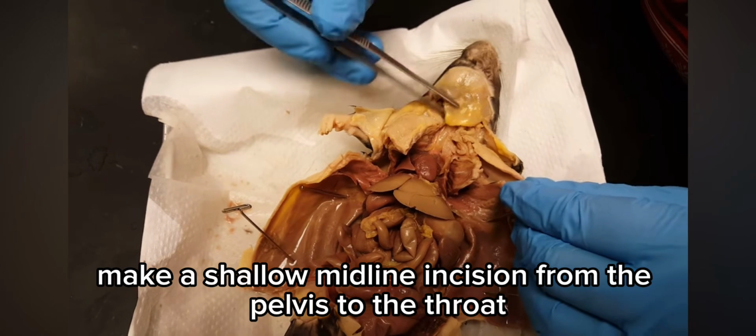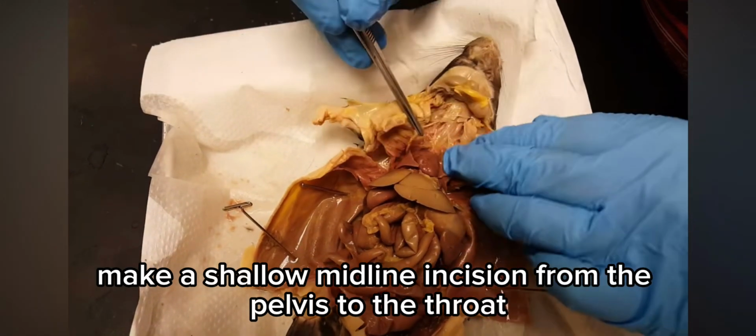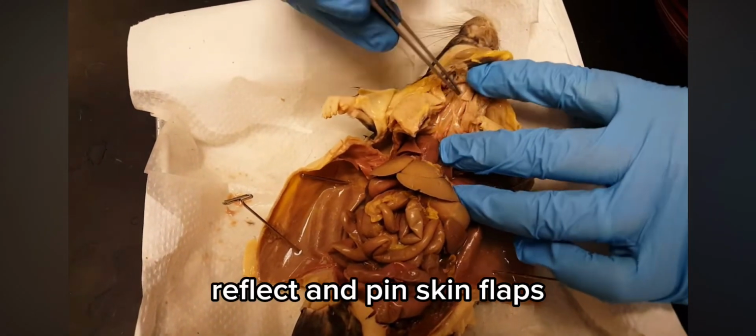Second, make a shallow midline incision from the pelvis to the throat. Reflect and pin skin flaps.